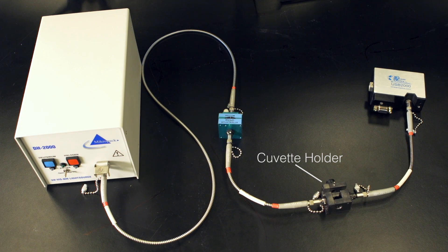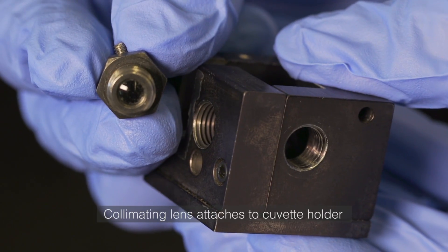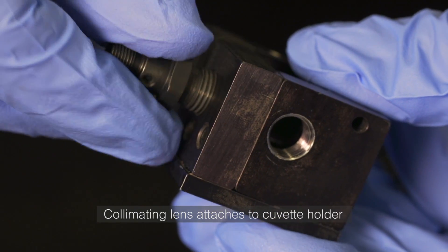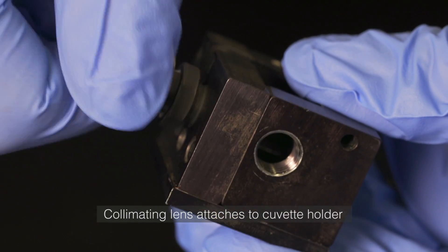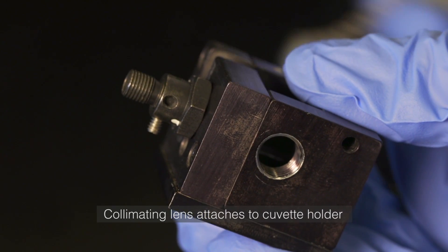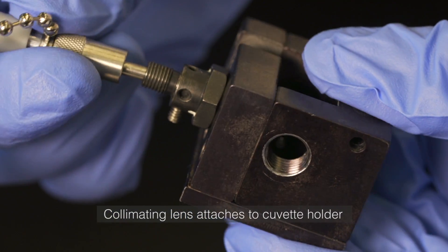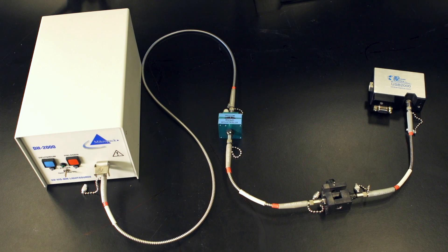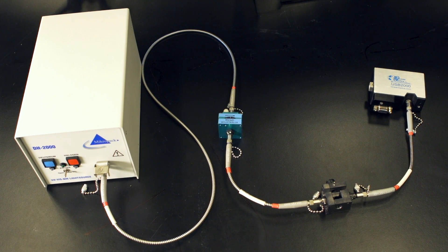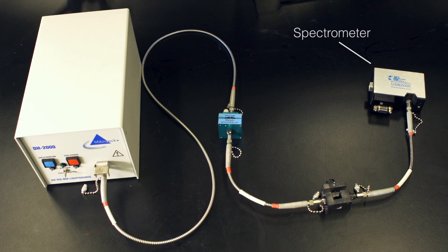From the attenuator, the light continues through the fiber optic cable to a collimating lens, which bends the light into parallel beams before it passes through the cell. The cell will contain a cuvette filled with solution. The transmitted light is then carried to the spectrometer using a fiber optic cable.